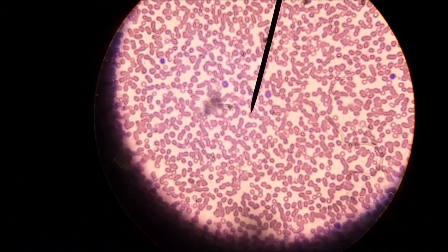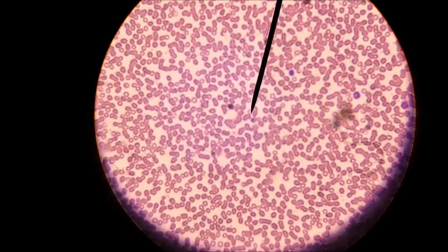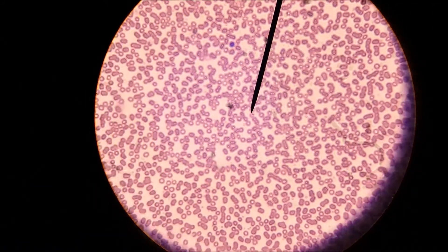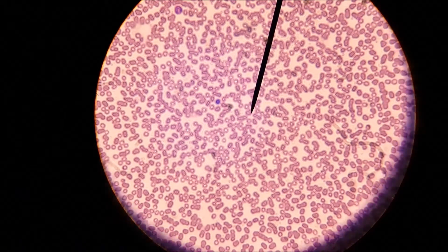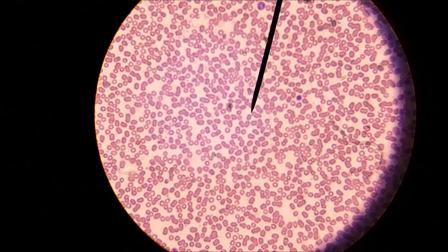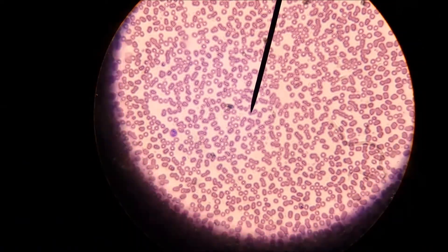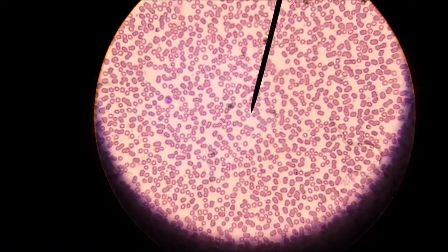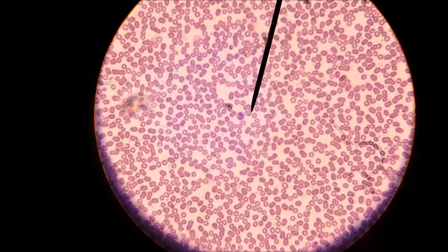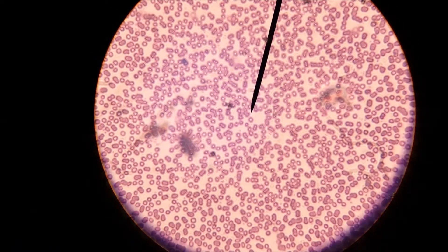White blood cell, white blood cell — and then this is a sea of red blood cells. When we say that the red blood cells are far more numerous, I just want you to get a grasp of that. The red blood cells are vastly more numerous, and you should be able to see — although these are very small from my view — some little bits in there.